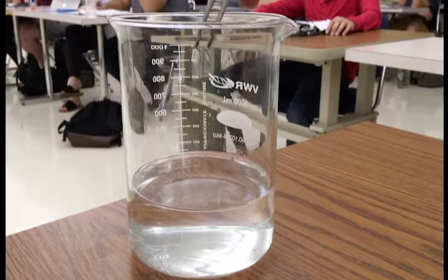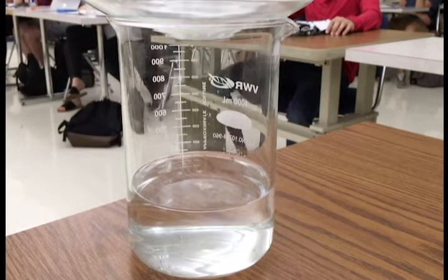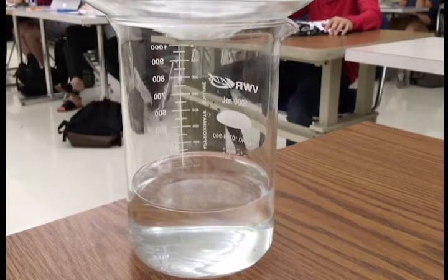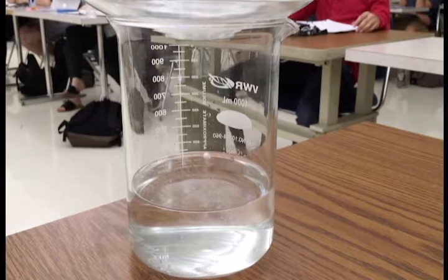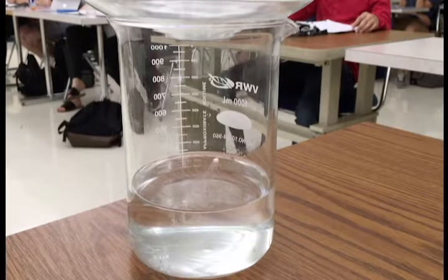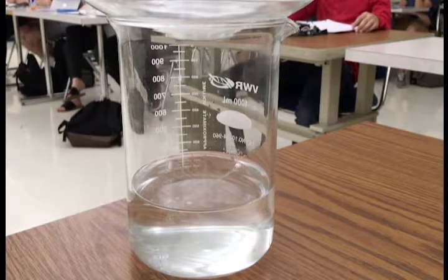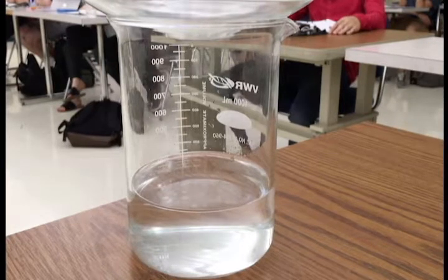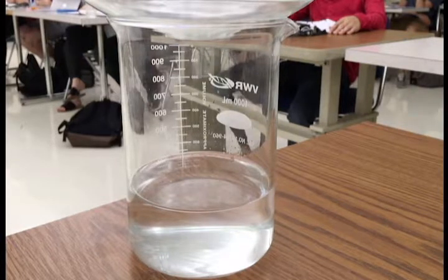Okay, I'm going to repeat the reaction by adding another piece of sodium metal with a forceps. As you can see, it is bubbling and it's moving rapidly across the surface of the water. What we will learn in general chemistry is that kinetic energy means motion. This is a very exothermic process. Lots of kinetic energy is being released, causing the sodium metal to move rapidly across the water.